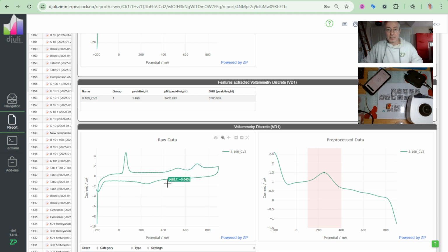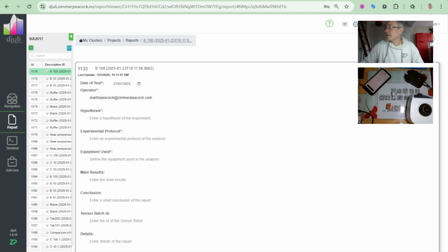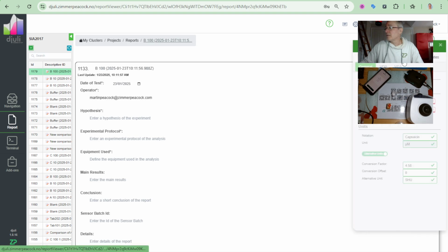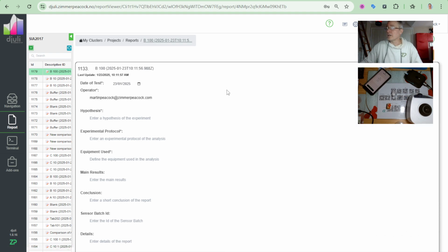So I've got my 3 peaks for capsaicin, so I can see my capsaicin. I can see my peak height here. I can go in here and I can have a quick look at my settings, that I did do my 1 in 100 dilution, and I can sort of close that off.